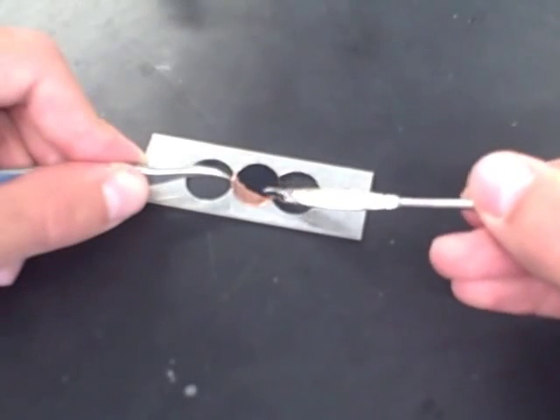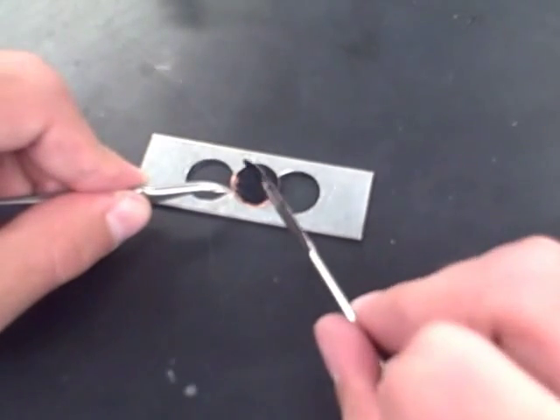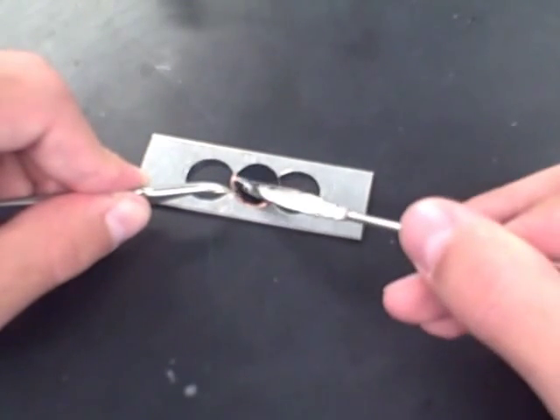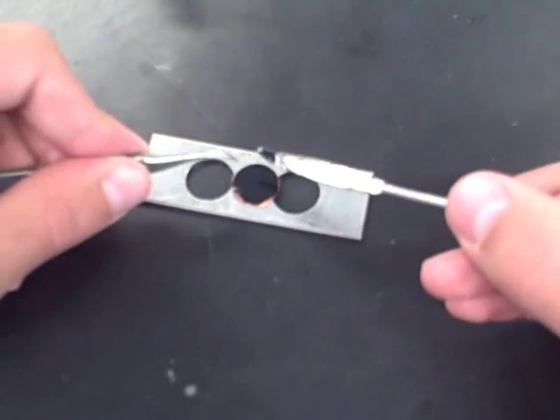The titanium nanotubes deposited with silicon are harvested from the plate. Polyvinylidene fluoride is used as a binder and the anode material is pasted onto a copper plate. After the solvent evaporates, the button cell is ready to be built.